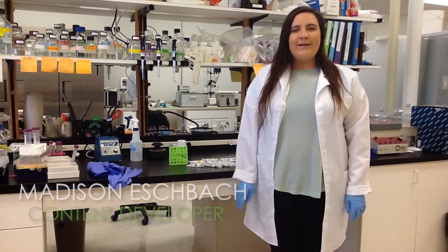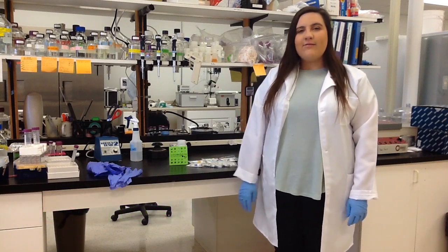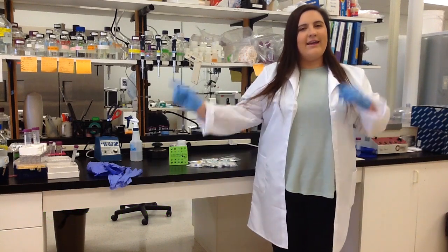Hi guys, it's Madison at Gold Biotechnology. Today we're going over how to load a DNA agarose gel using our DNA ladders. Let's go ahead and get started.